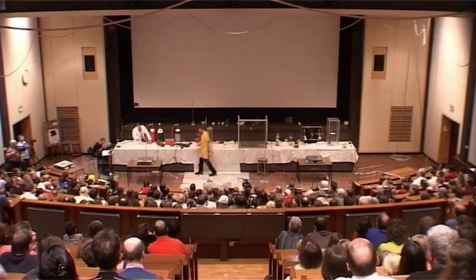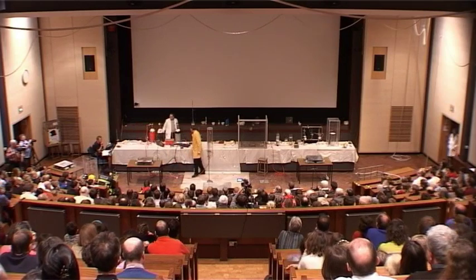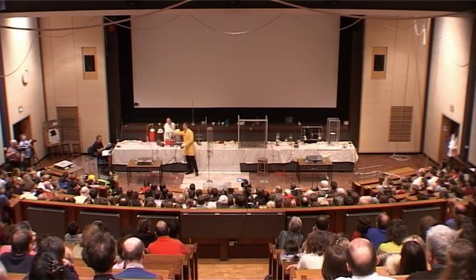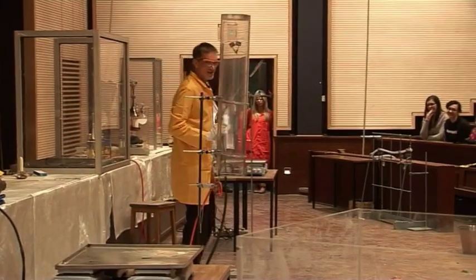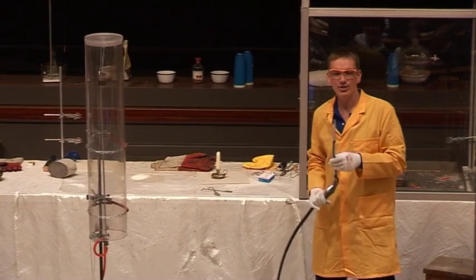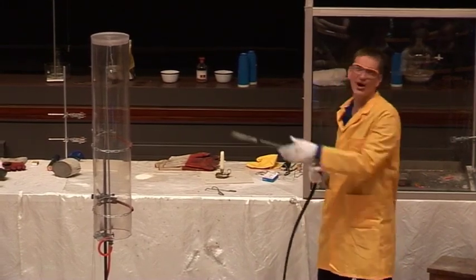This tube now contains hydrogen. Remember my oxygen gun — remember how we couldn't light the oxygen gas? Well, we can't light oxygen in the air because oxygen doesn't burn in air. But can I light it inside the hydrogen?